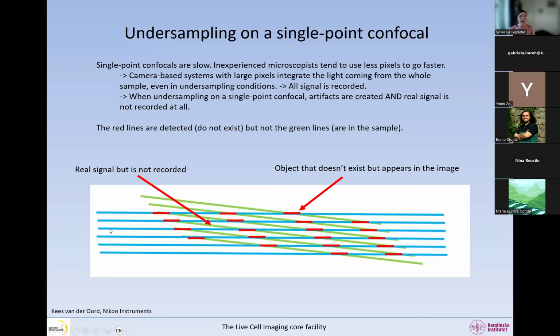So for example, here we sample along the blue line, so we're going to take dot, dot, dot, dot, dot, right? And now we are sampling only at this distance, so we're sampling where we have the red things. And this is our sample, it's green, and it has a certain orientation compared to the way we scan. What we're seeing actually is these red lines, and these red lines do not exist in the sample. So we're creating artifacts. But on top of that, in the middle here, we do not detect this at all because we don't measure it. So the red lines are detected but they do not exist, while the green lines are not detected and they are in the sample. So we're creating artifacts and we're missing information when we undersample on a single point confocal.